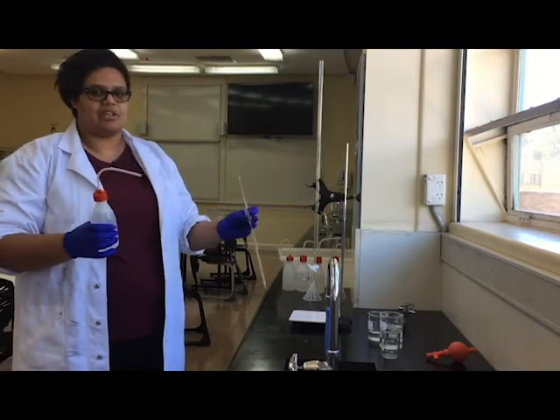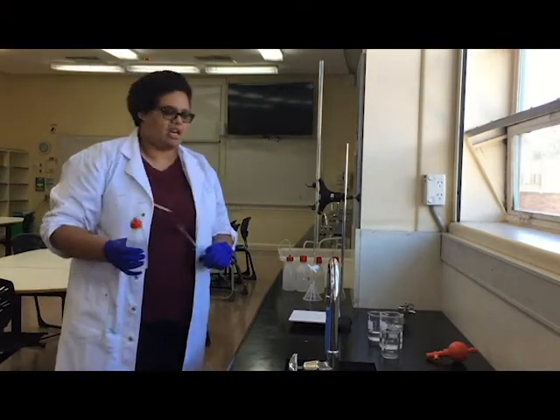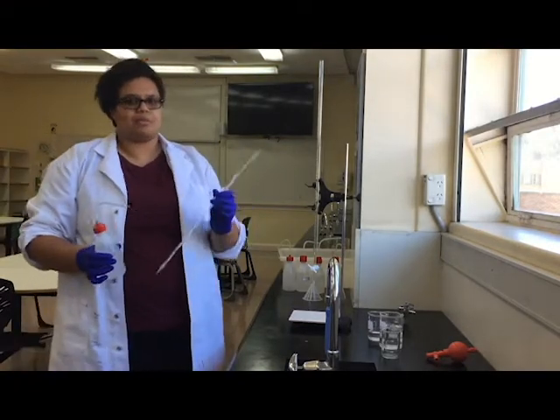Okay, so in this video we're going to practice doing a titration, starting with cleaning of the equipment and then performing the titration. Cleaning is very important and we have to follow some proper steps first.